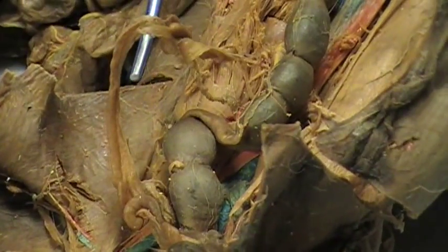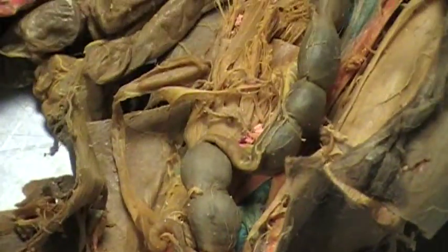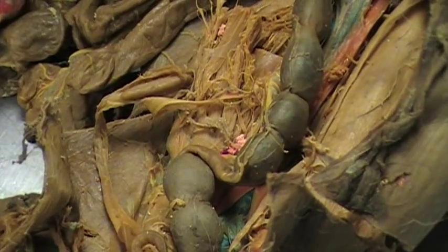As far as the circulatory system goes, that's all dissected out and it came out pretty good. The baby in the other one was in the uterus — that little horn that I was holding up here. That's how much it dilates. This fills up; they'll hold up to four. This is a little rabbit, probably a little girl, whereas that was a mother. It'll hold up to four fetuses; they go all the way up to here and push up against the stomach.